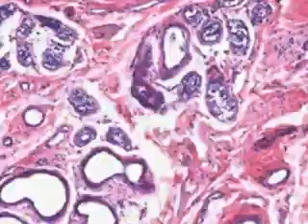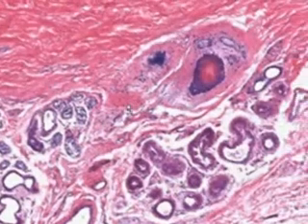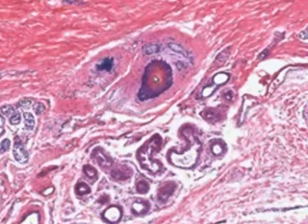Also, let's go down to a hair follicle, and I want to show you a point of differentiation here as well. A hair follicle will almost always have in the middle of it a slightly more refractile substance, which is the hair shaft.